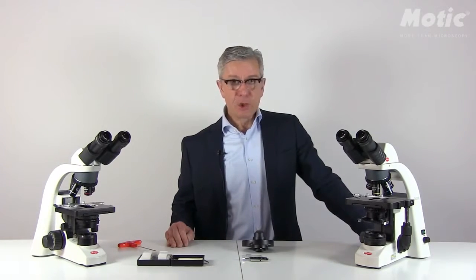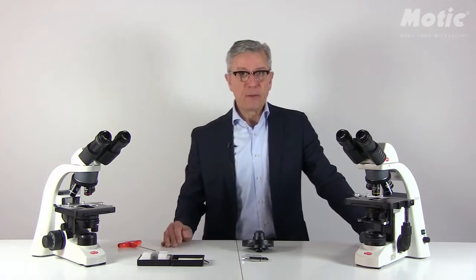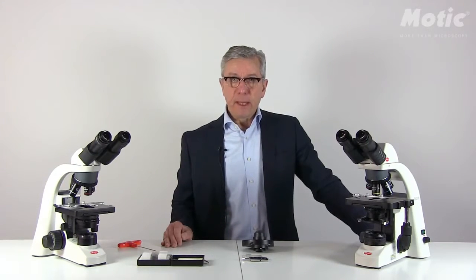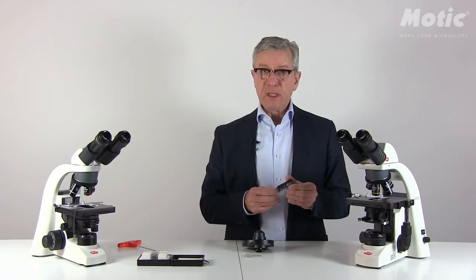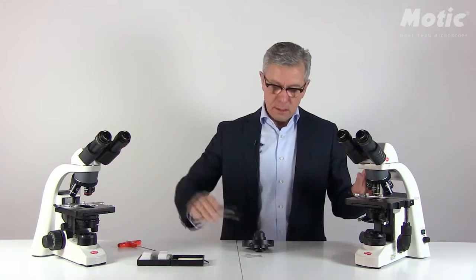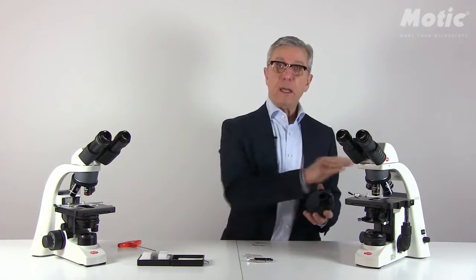Today I'd like to show you some details about our darkfield solutions in our series of BA upright transmitted light microscopes, BA 210, 310 and 410, respectively the elite versions of those models. In these cases, darkfield can be applied in two options. The simple and the more economic one is to use a darkfield slider. This darkfield slider has to be combined with the standard condensers of BA 210 and 310. The more elegant turret solution works with the 310 and the 410.